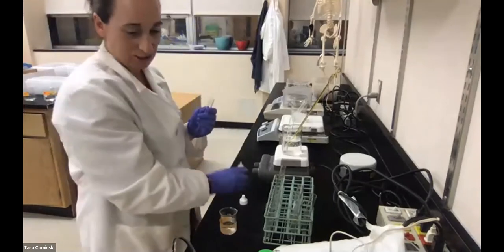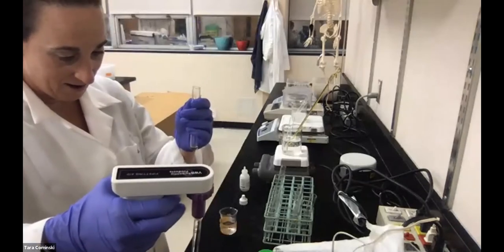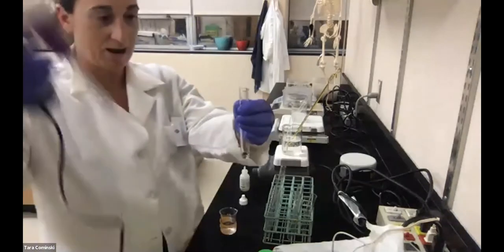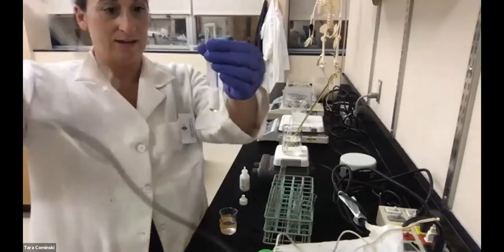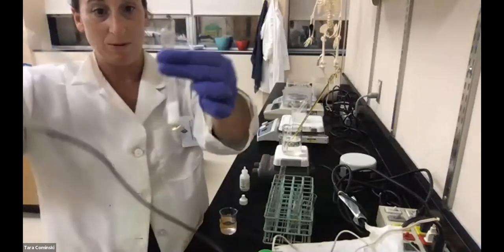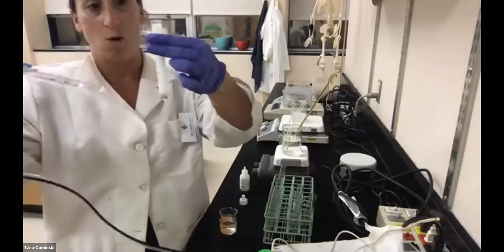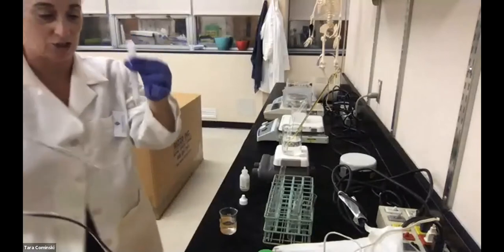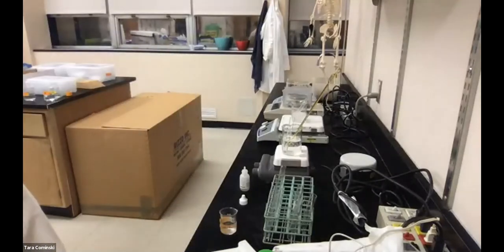All right, so let's go a little slower here, just so you guys can see. Here's my hydrogen peroxide, right? And when I add it, you can see how much it bubbles. When I added this, it basically went the whole height of the test tube. So I'm going to use that as my measurement, okay? So what happened to my ruler?